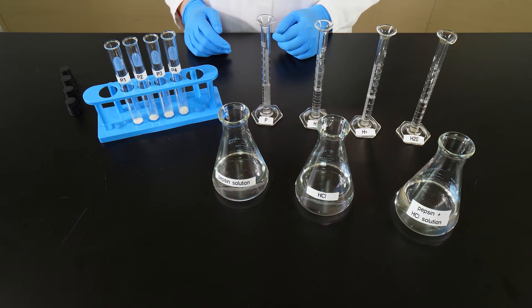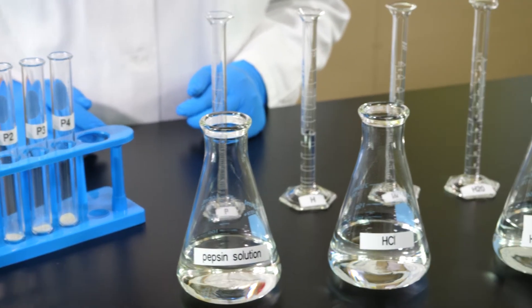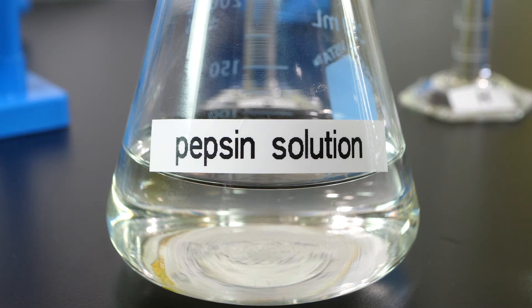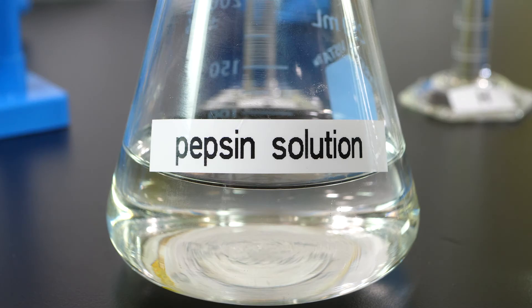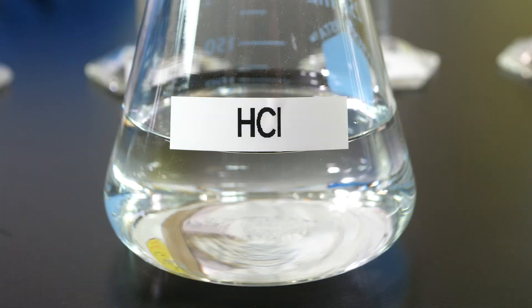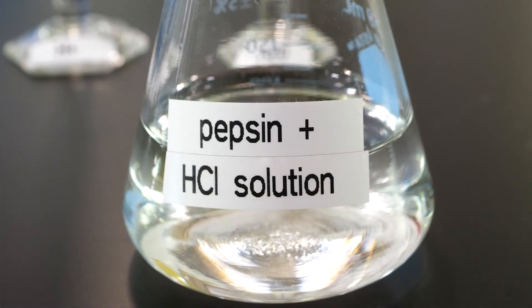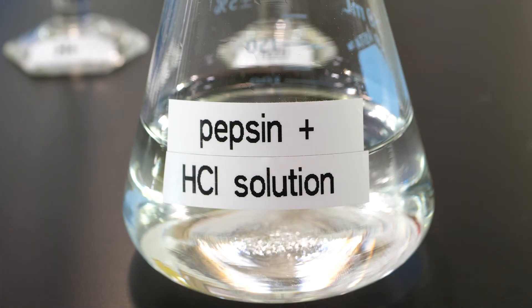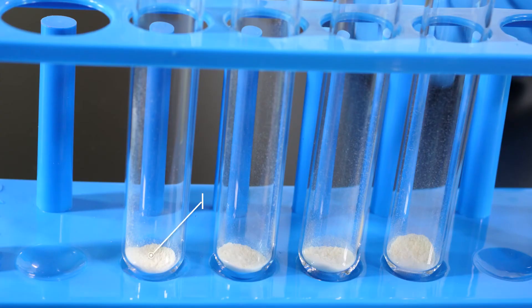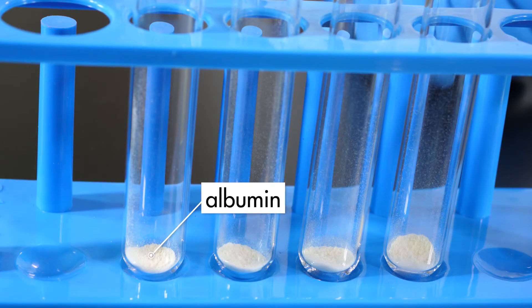We will do an experiment to demonstrate the importance of pepsin and acid in the digestion of proteins. Three solutions will be tested to determine how each reacts with proteins. The first solution is a pepsin solution consisting of pepsin dissolved in water. The second solution is a diluted solution of hydrochloric acid. The third solution is a mixture of both pepsin and hydrochloric acid. The protein we are using in this experiment is albumin, which is the same protein found in egg whites.